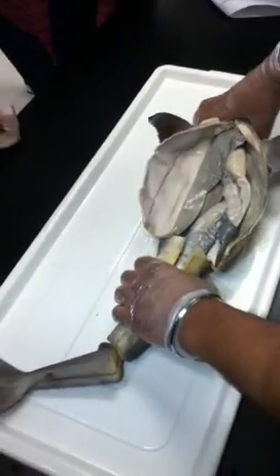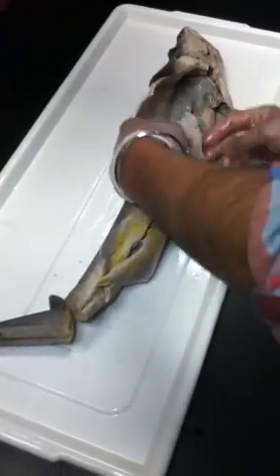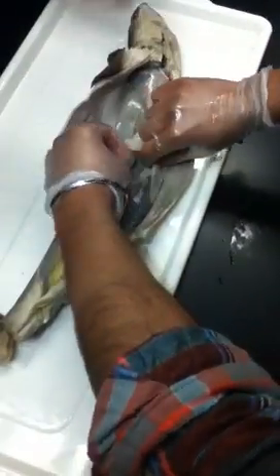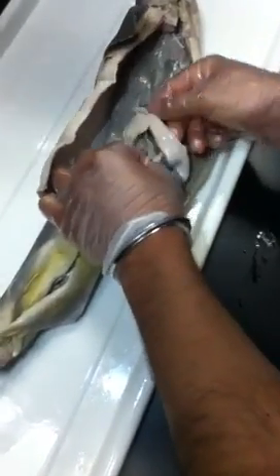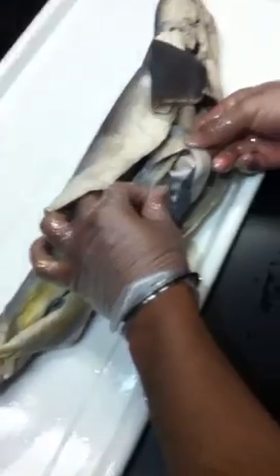So the first part of the intestine is the duodenum. Right. So I think this is the duodenum. Yeah, just the very beginning. Right, that part, and then over here, down next to that, the strip-like pancreas, right? Right. And so show that off. Okay, so if we look inside, this is the pancreas right over here, and they're going inside the duodenum basically, merging there. Yeah, this is the pancreas, and then this is the duodenum. I just like saying duodenum.